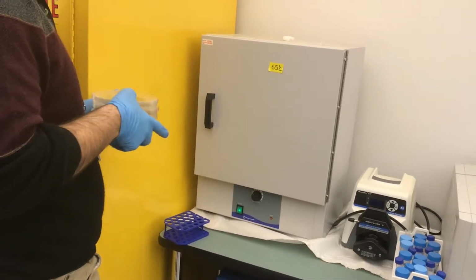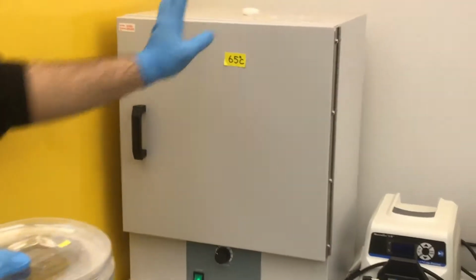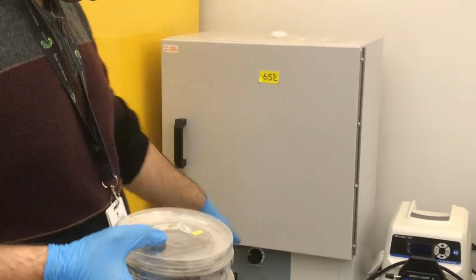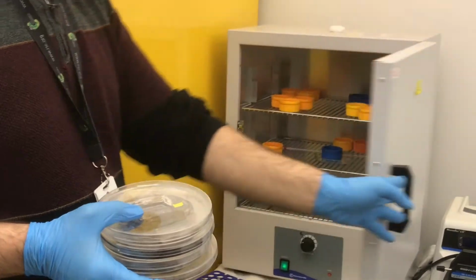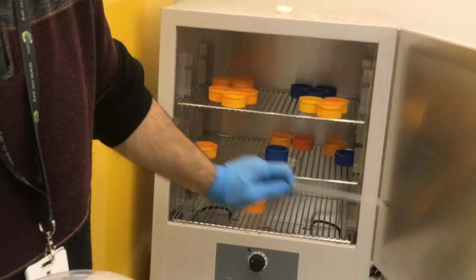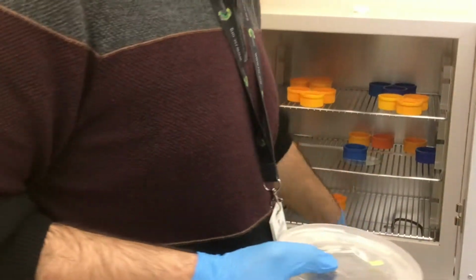So how do you set this temperature over there with that knob? Yeah, you do it with this one. But nobody is supposed to change this setting. That's the thing I want to say. Do not change the position of the oven, and do not change anything here, because if you change it a little, it affects the temperature. I put one thermometer here to always check the temperature inside to make sure that it's 65. But if you change it, it takes time to return to the previous temperature.